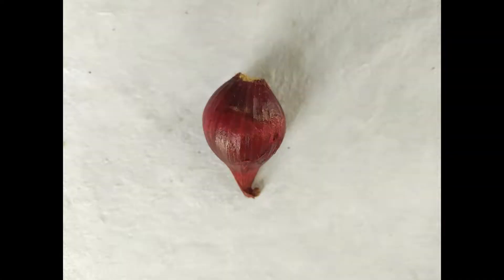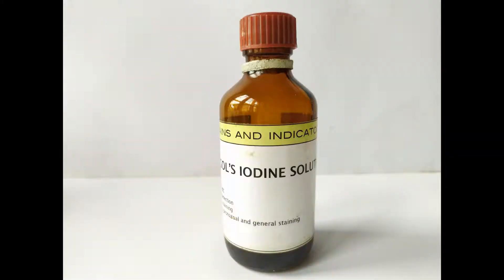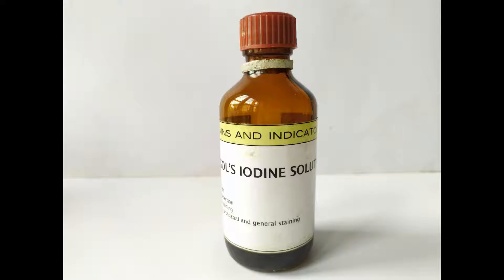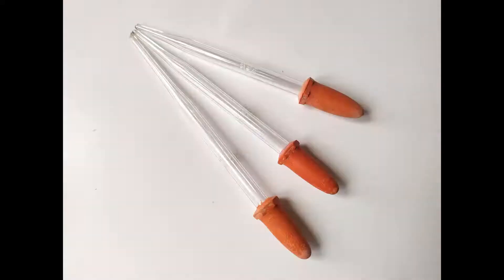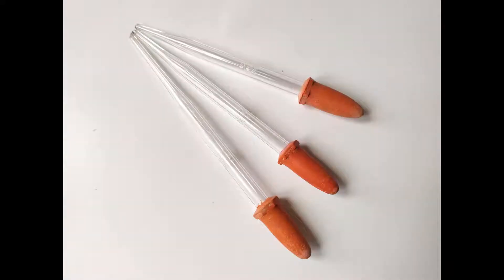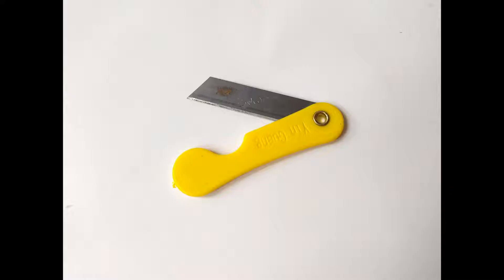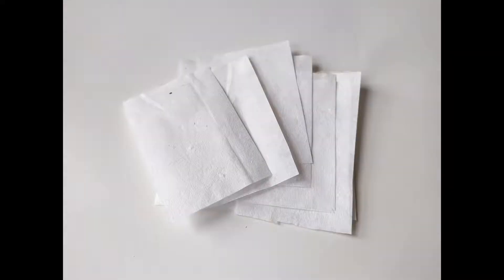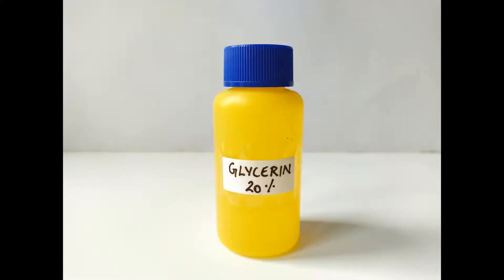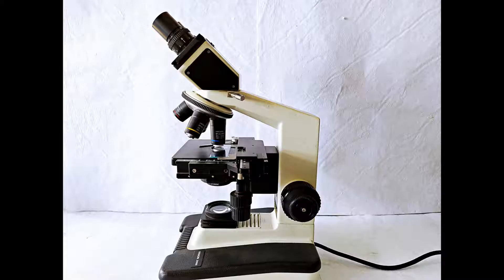Onion bulb, iodine stain solution, glass slides and cover slips, droppers, tweezers and pins, a sharp razor or blade, blotting paper strips, glycerine, and a compound light microscope.